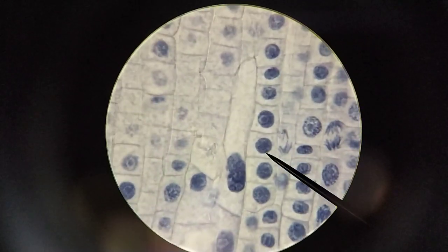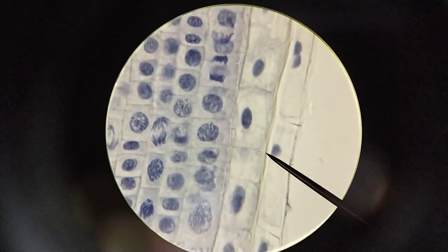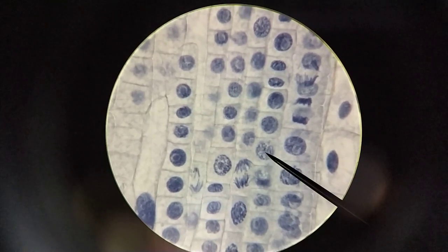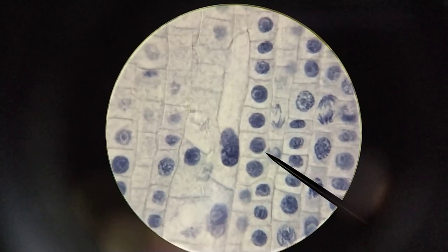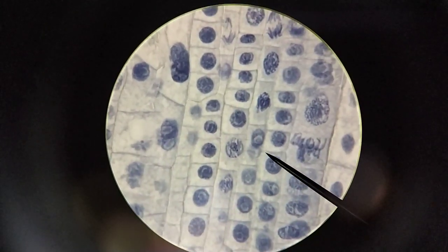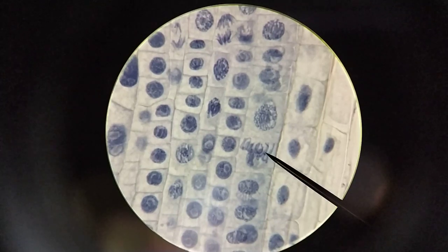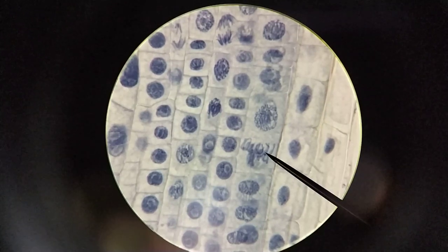Here you can see chromosomes being divided between the two different poles of the cell. The stage we're looking at here is anaphase, and there's another anaphase here as well. The nearby nucleus and the one over here show just condensation of chromatin - that is prophase. This one here is prophase, and this one is prophase as well. Notice that lots of other cells are not doing any mitosis at all - they're just sitting in interphase. After prophase, the next stage is metaphase, and here the chromosomes have been pushed toward the middle, with the pointer indicating the metaphase plate going across horizontally.